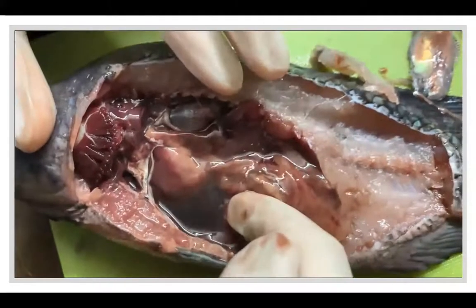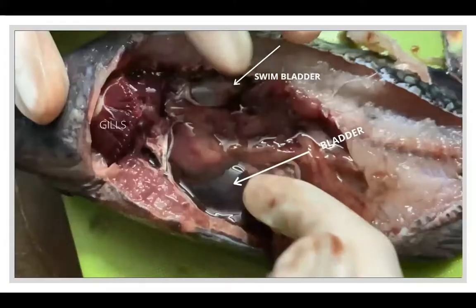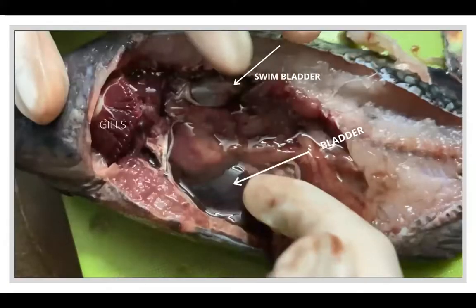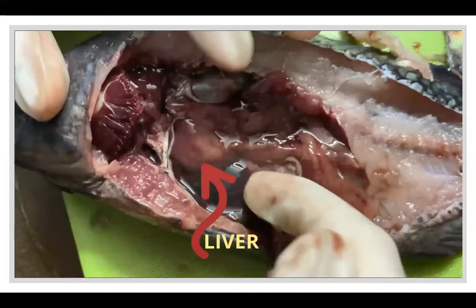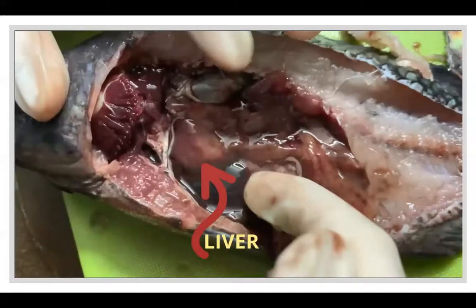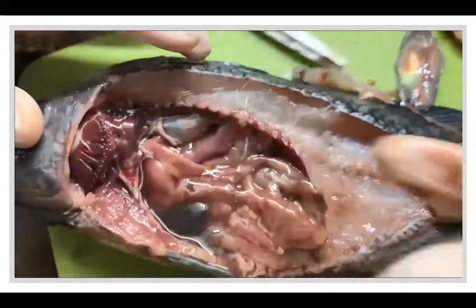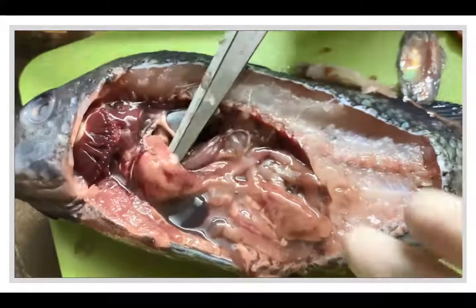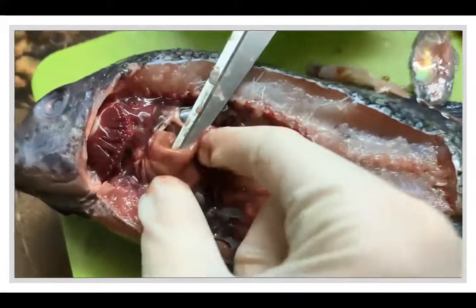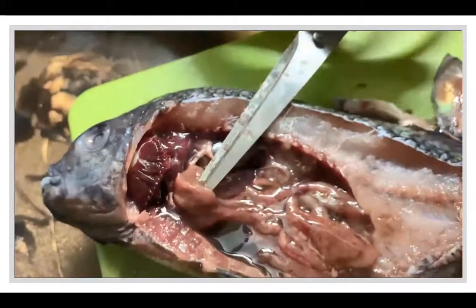This small sac is the gallbladder; it contains and stores bile secreted by the liver. This is the liver of the fish — a reddish-brown color found near the gallbladder. Its texture is slightly different from the other organs. It assists in digestion by secreting enzymes that break down fats, and it serves as a storage area for fats and carbohydrates.